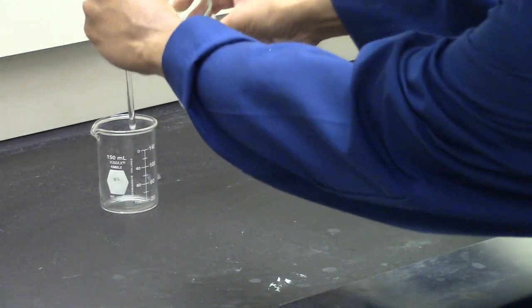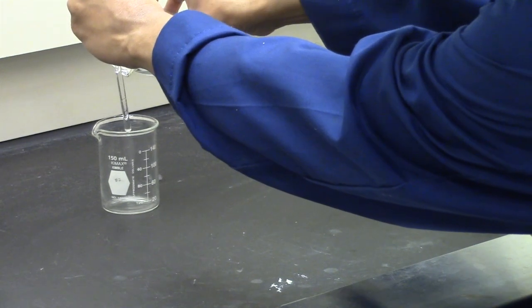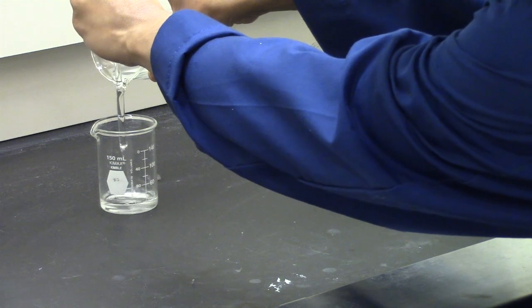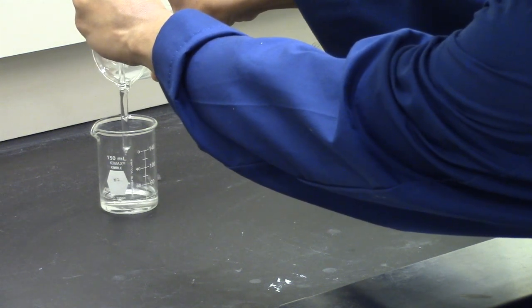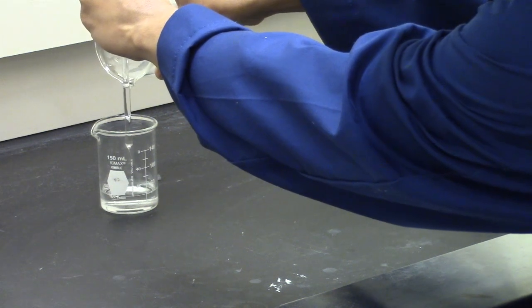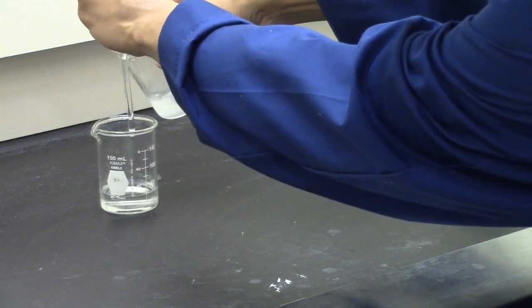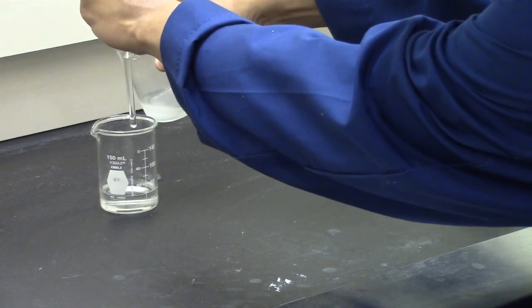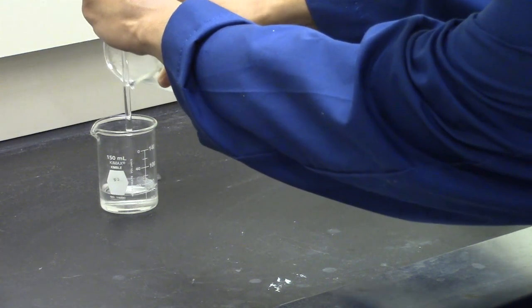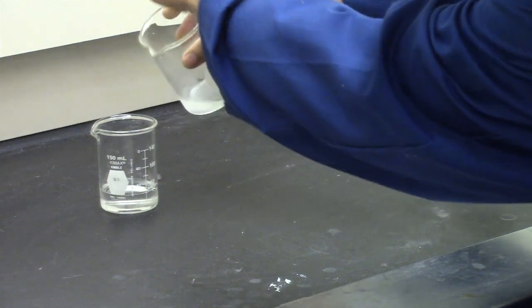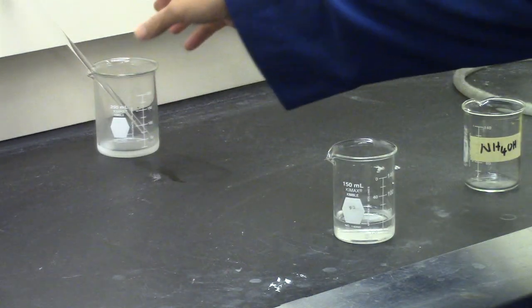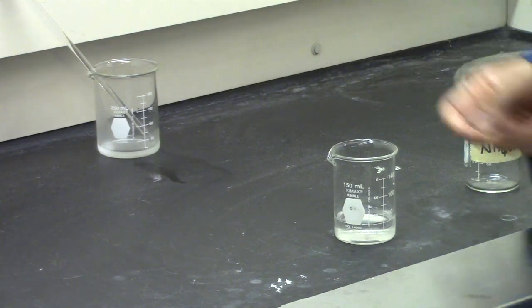Get a 150-milliliter beaker. After a few minutes, the sodium chloride will have settled to the bottom of the beaker. Decant the saturated solution into the 150-milliliter beaker. Leave the 250-milliliter beaker containing the sodium chloride and remaining ammonia in the back of the hood to be cleaned later.